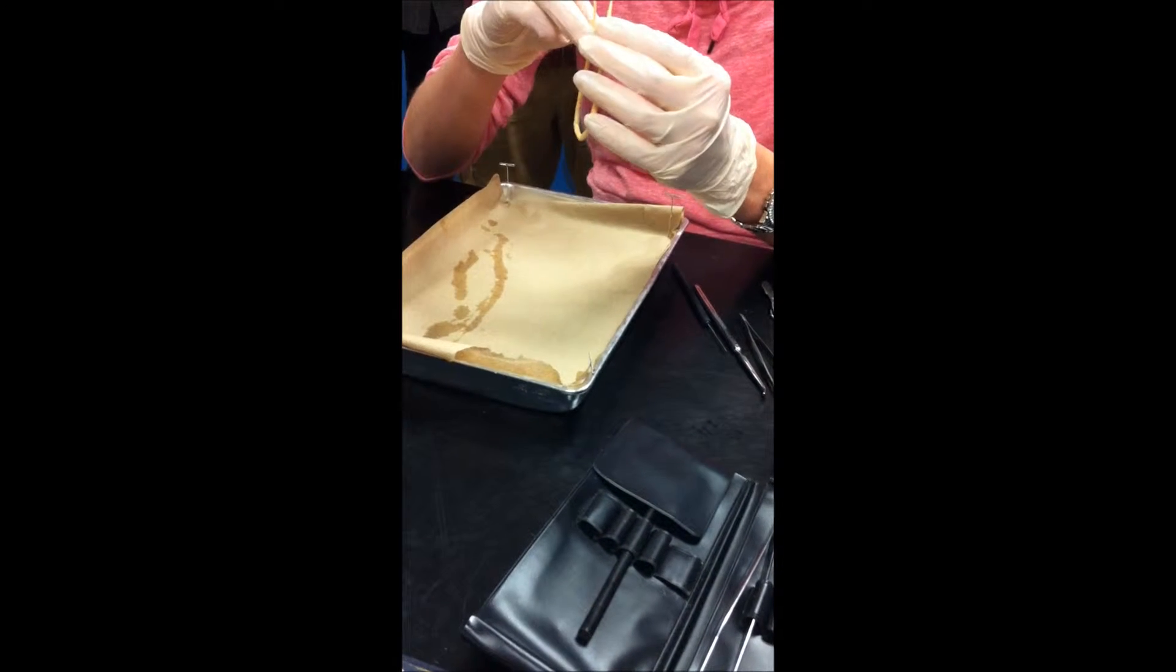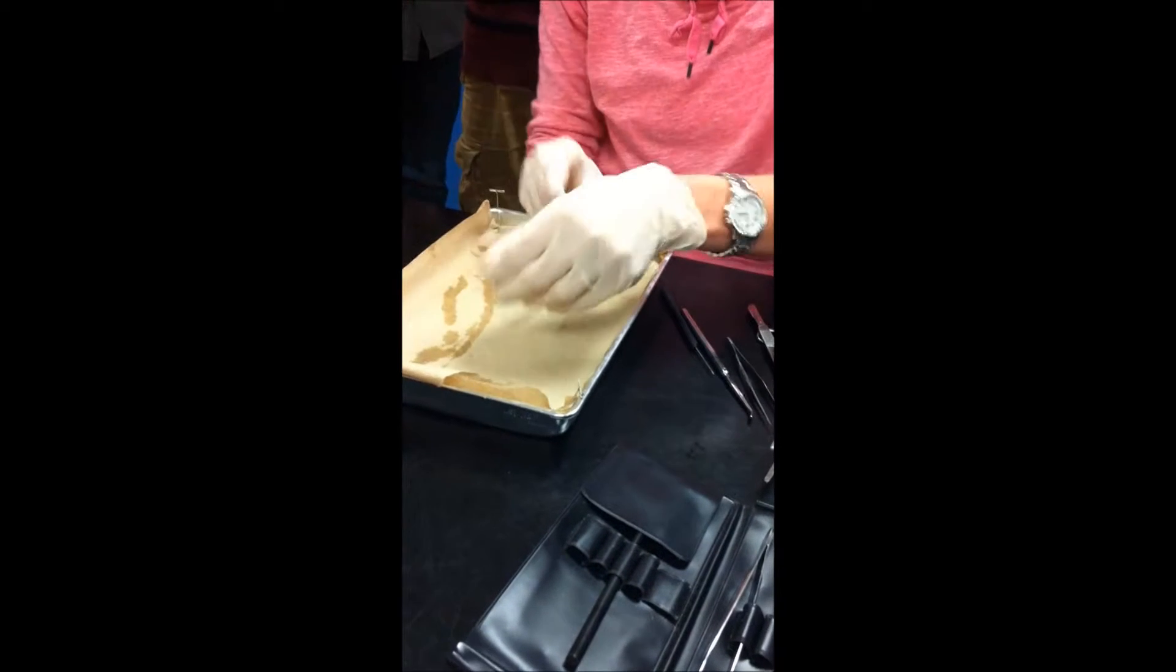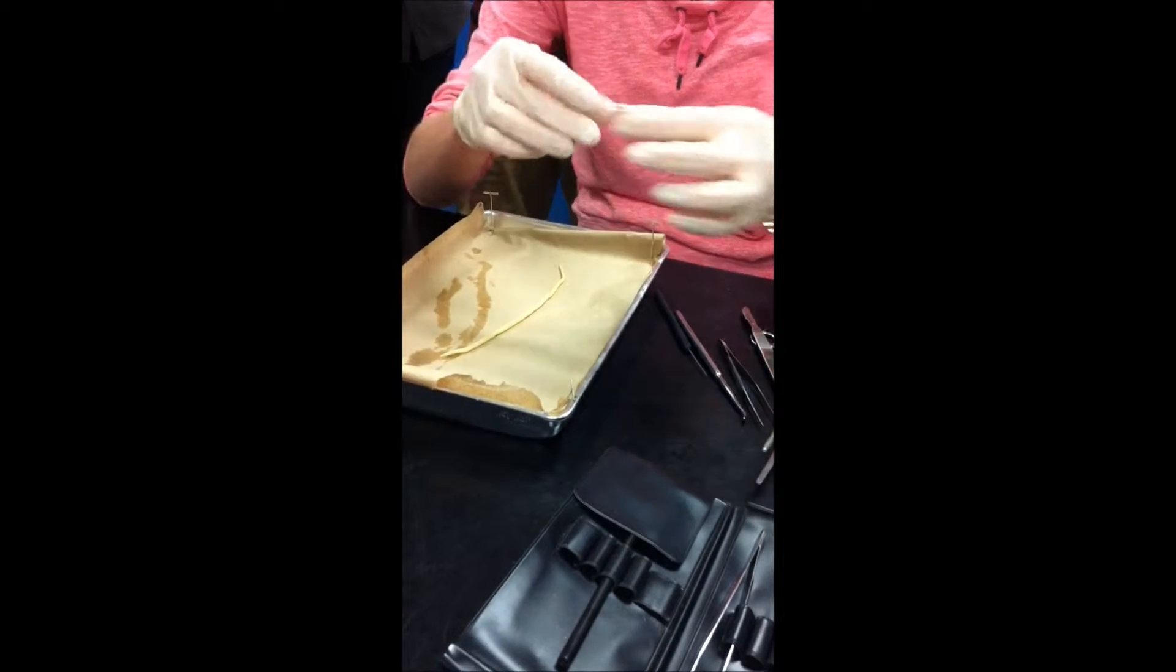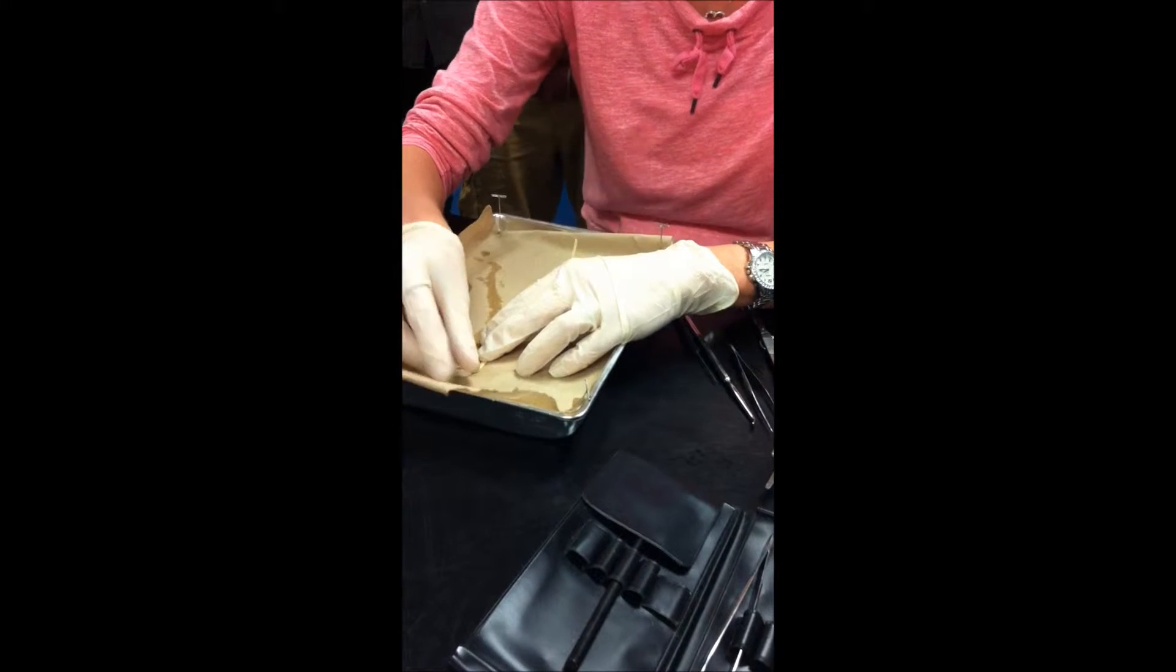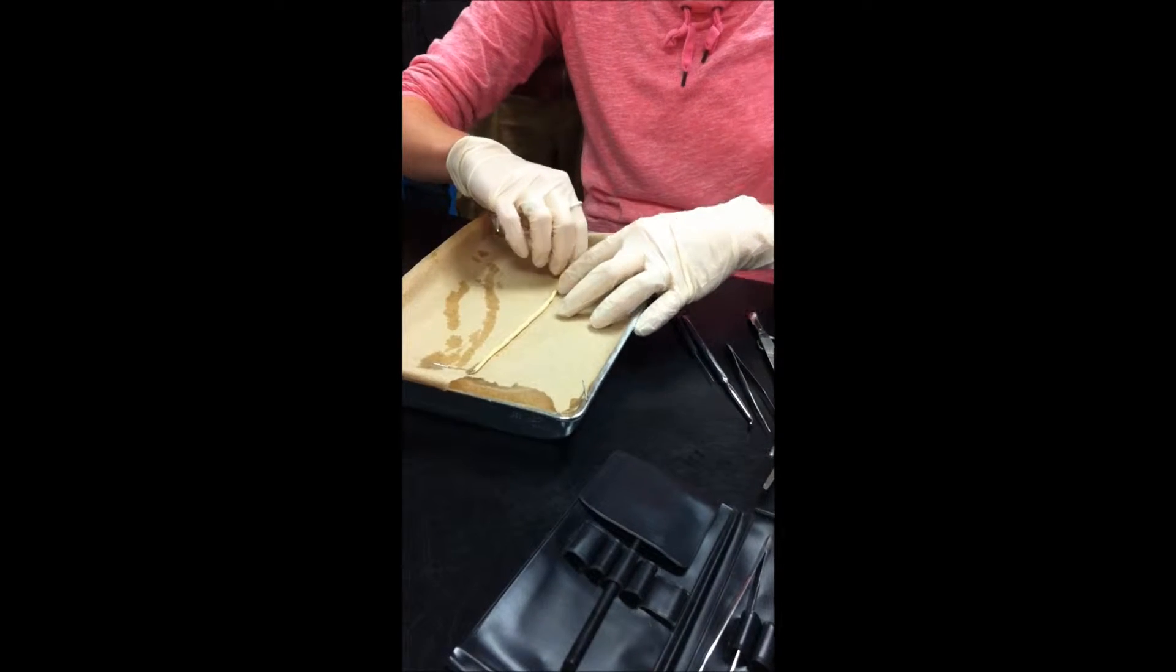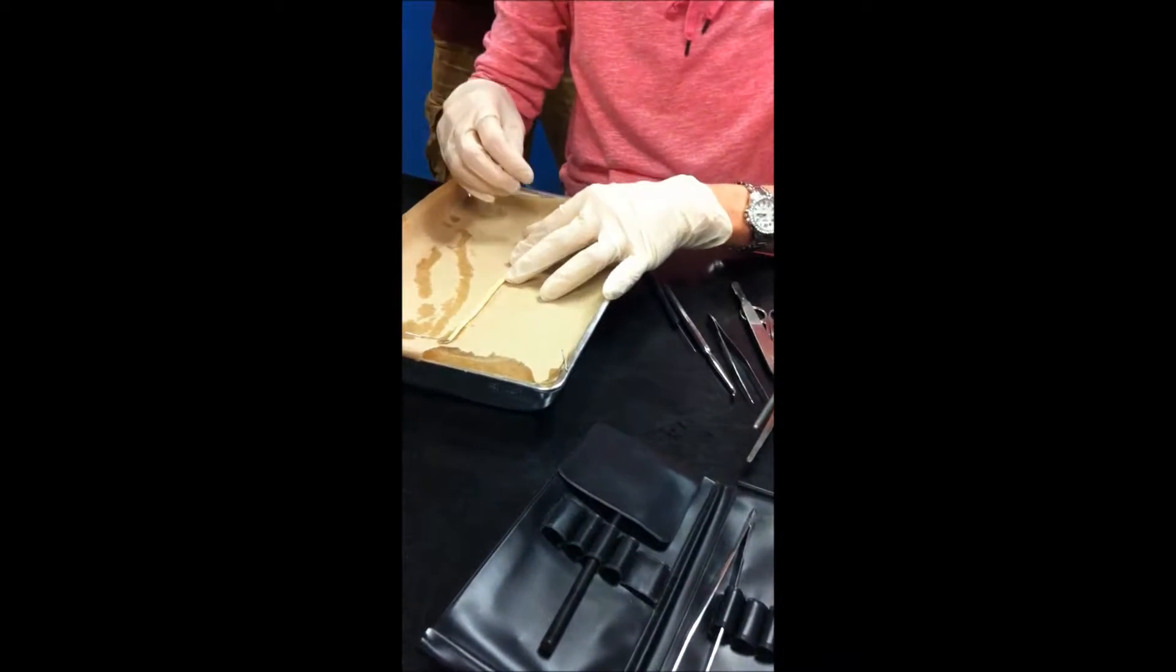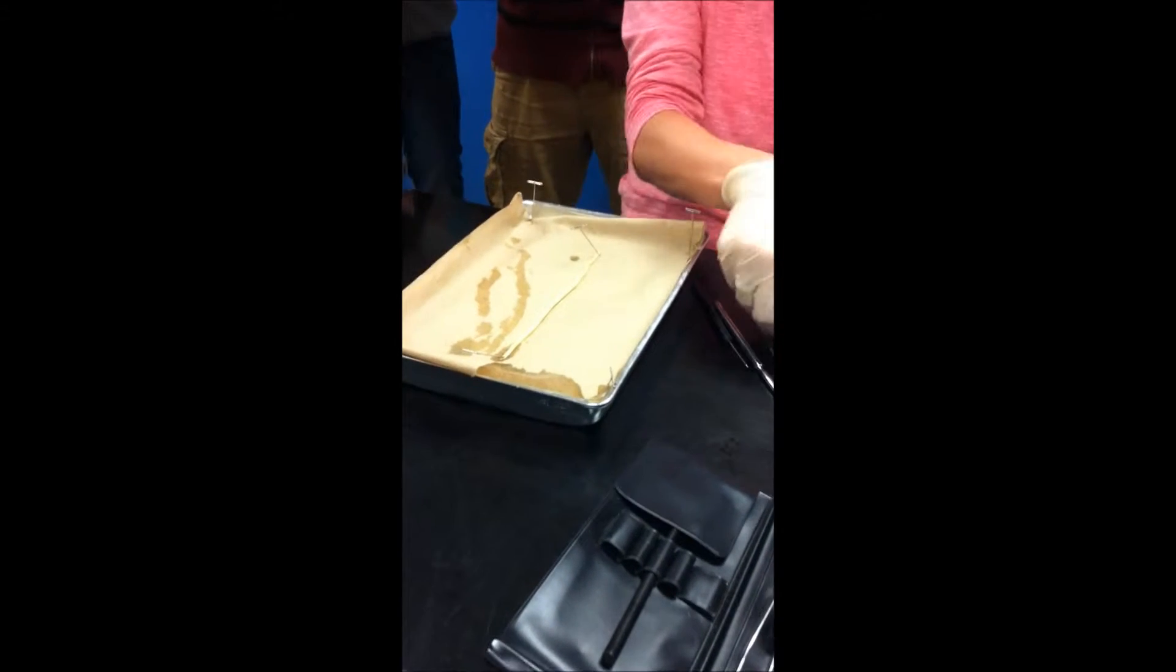You can kind of compare the ends. If there's anything special or different, I'm looking at which sides, the anterior and posterior. And so, to start our dissection, we're going to secure the specimen down to the tray. That's the worst part. Securing the specimen is the worst part.